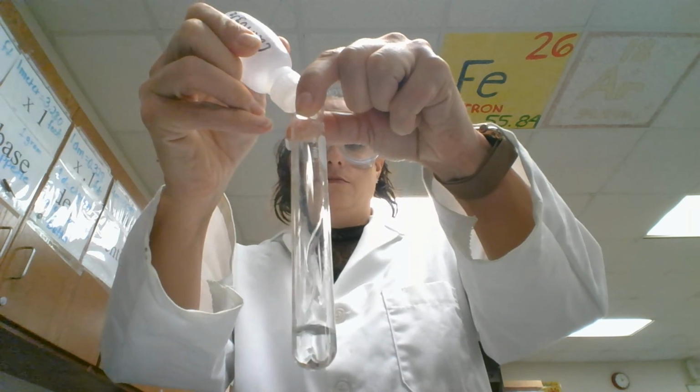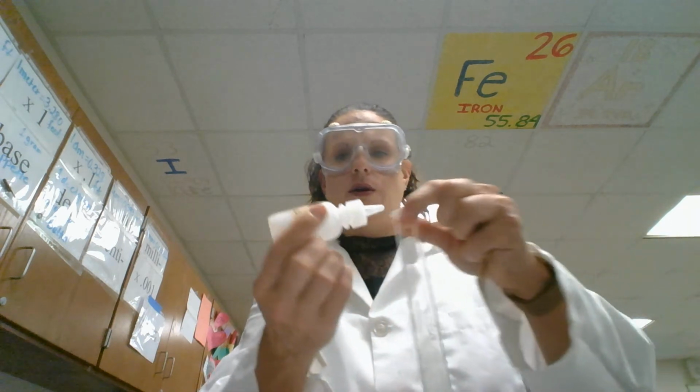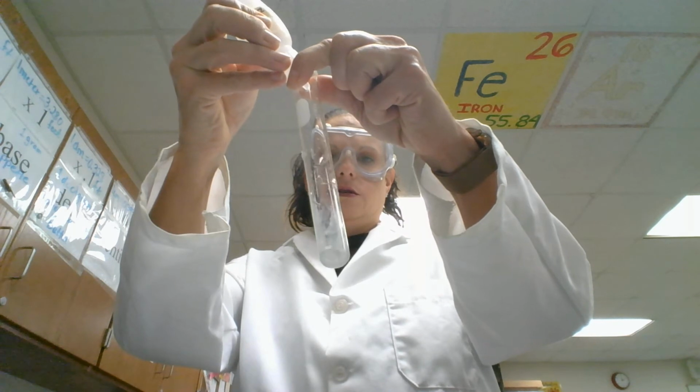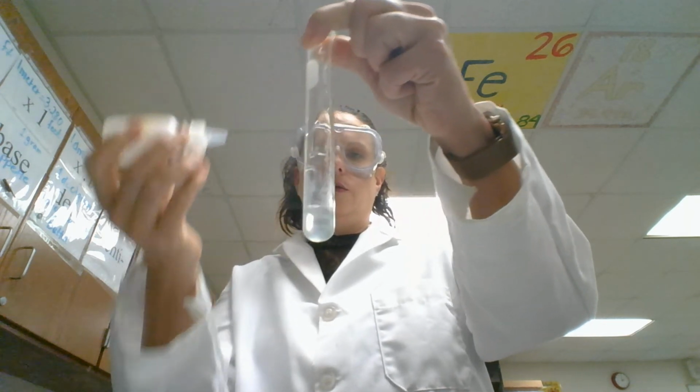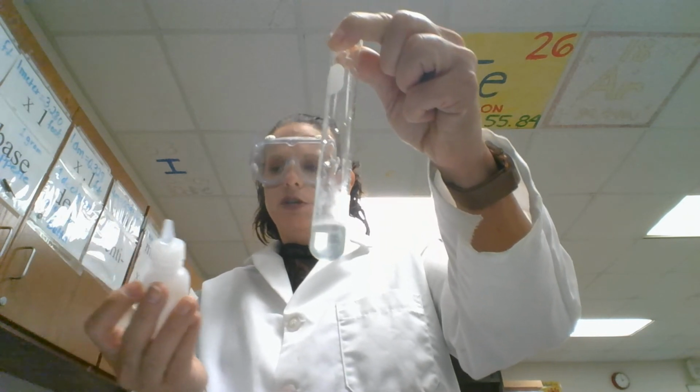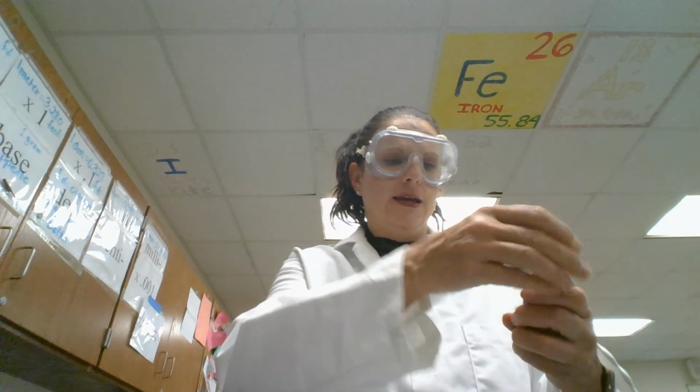And then our third alkaline earth metal compound is strontium. Didn't get the best test tube in this one. It's a little bit cloudy already. This one's strontium nitrate, Sr(NO3)2. And then lastly, we have barium nitrate, Ba(NO3)2.